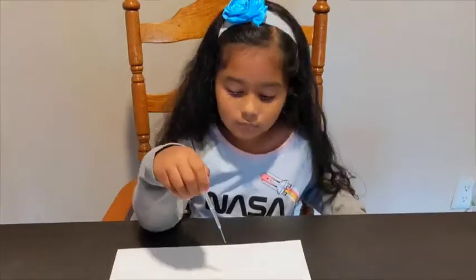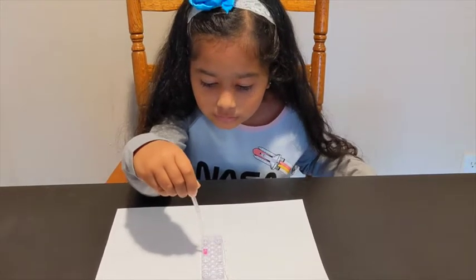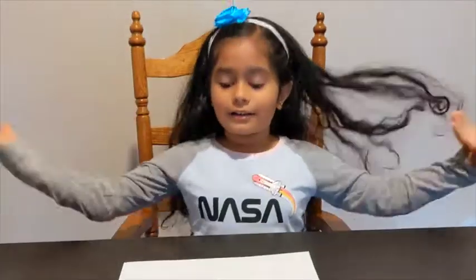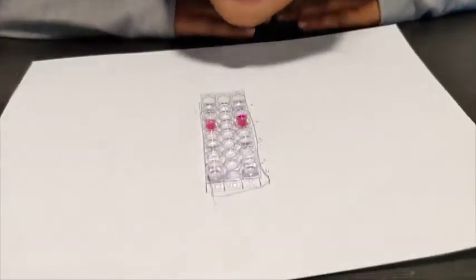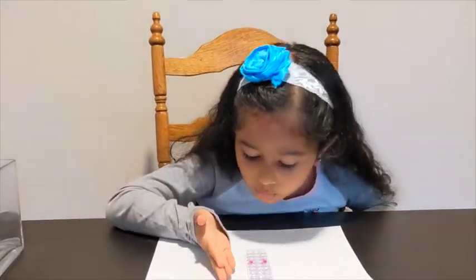Let's see if my prediction was right or not. Let me remind you — I predicted sample 1 had the coronavirus. My prediction was right! Look, it turned pink. Wow, it looks awesome. This color change, clear to pink, indicates the presence of the virus.